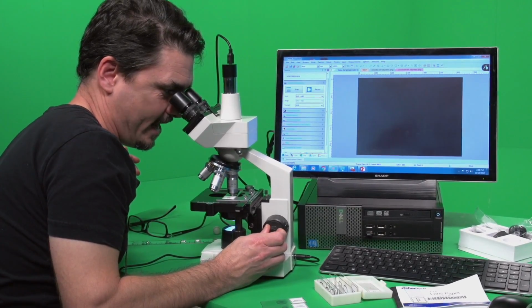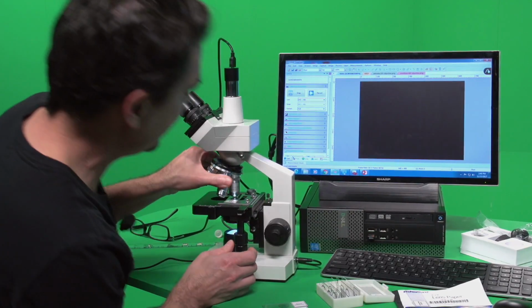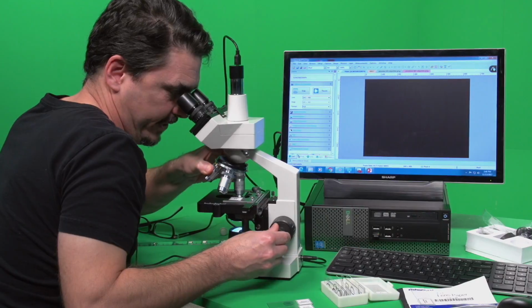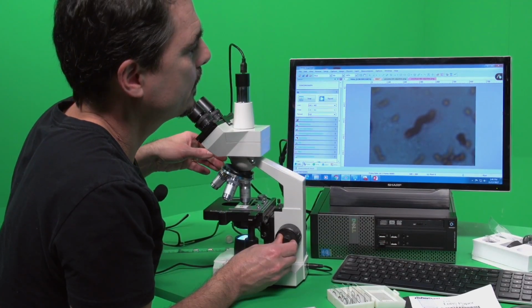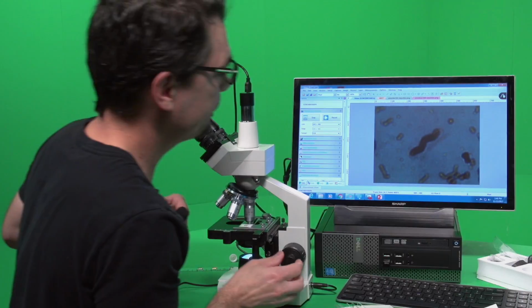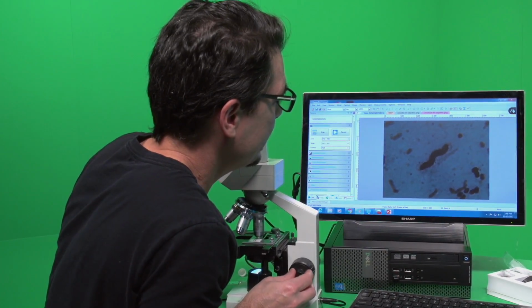And right now, it's not. It's all really goofy. That must mean that I didn't put enough oil on or did not make enough of a column. So I'm just kind of moving it around, hoping that I put enough on there. There we go. All right, so let me throw my glasses on here. Yeah, so that right there is much clearer.